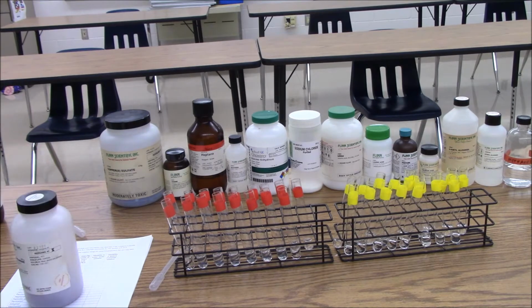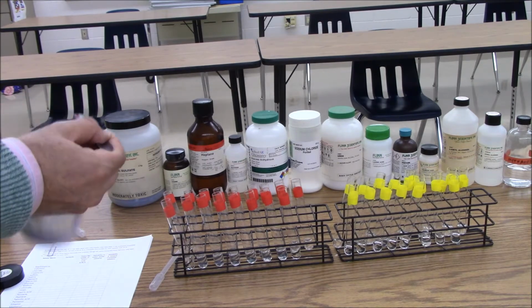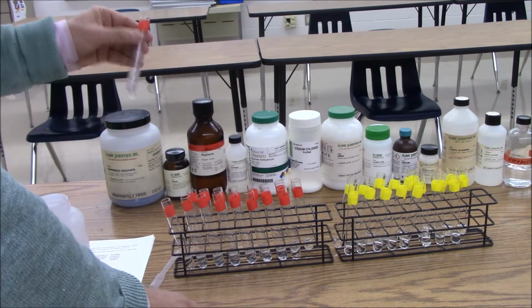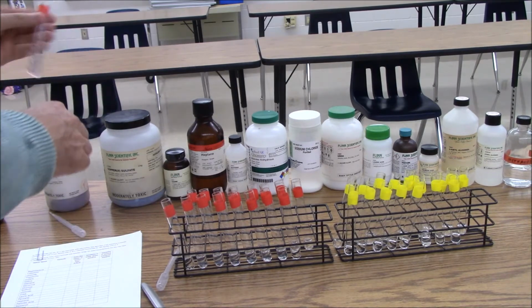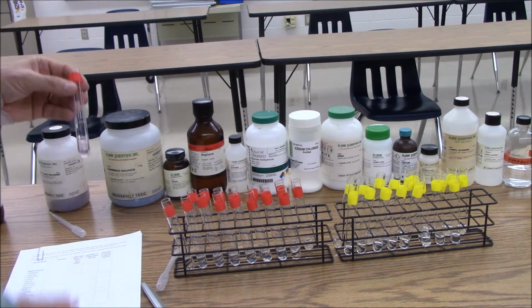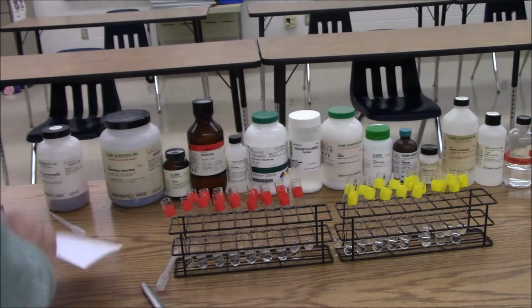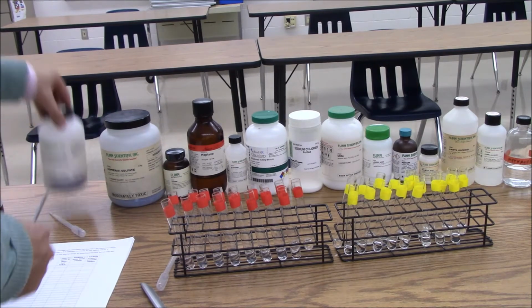So like I said, I won't be telling you every time whether things are polar, nonpolar, or ionic. So a little bit of cobalt-2 chloride. Into the water it goes. Shake it up. See if it dissolves. And I purposely chose this compound because cobalt ions have a color to them. So you can see here that the water's taken on the pink color of the cobalt ions. So cobalt chloride is soluble in water.